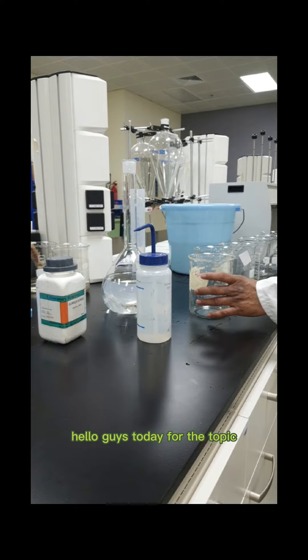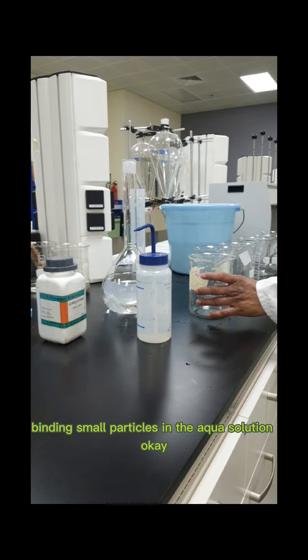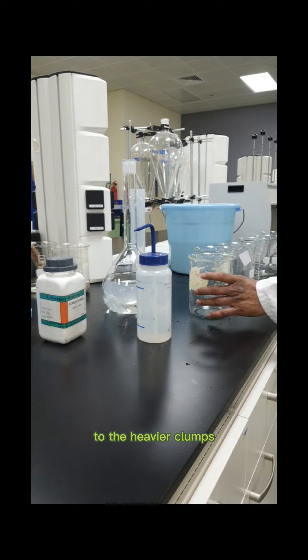Jar test for coagulation and flocculation. Hello guys, today's topic is coagulation and flocculation. Coagulation and flocculation is the process of binding small particles in aqueous solution together into larger or heavier clumps which will settle down very quickly.